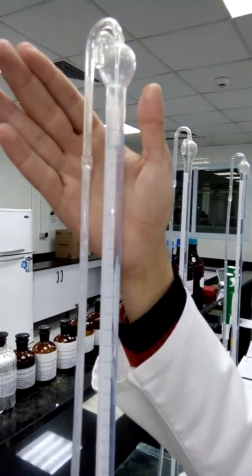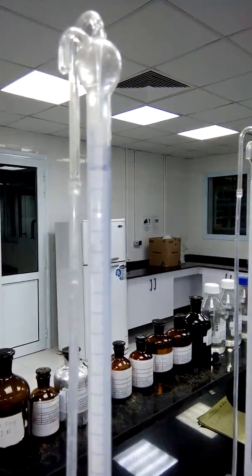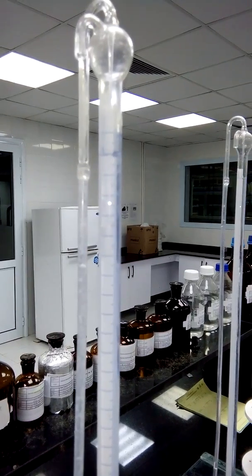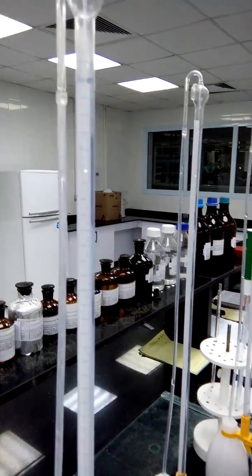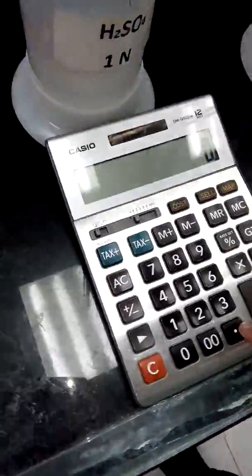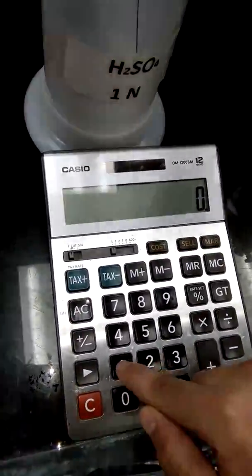The amount of NaOH is 1, so by calculator I can count the amount of acidity.